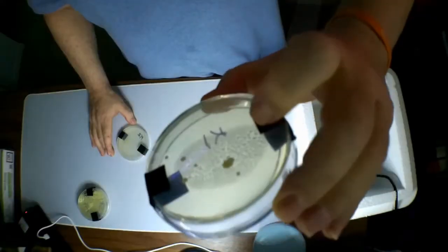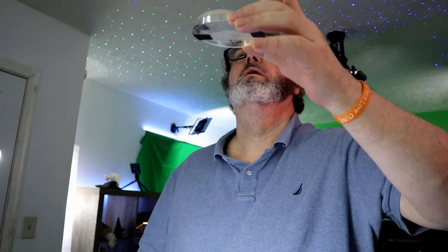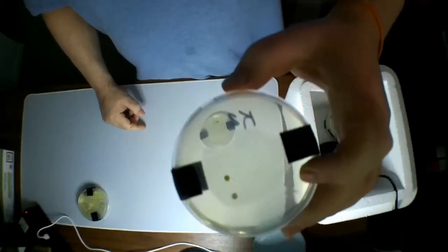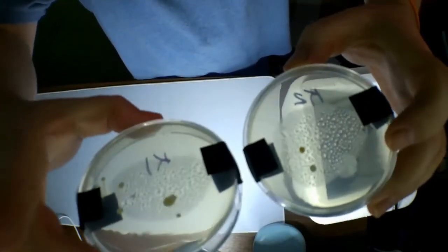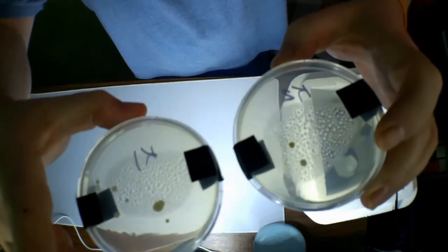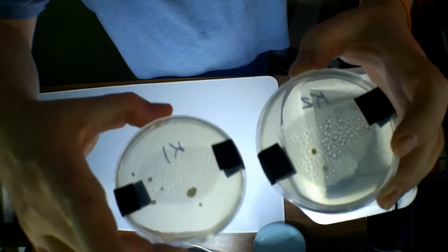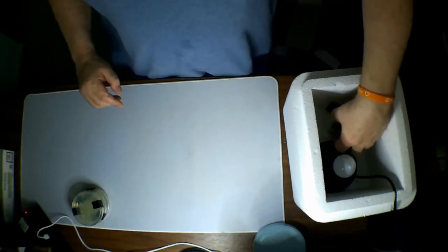So what's next? The keys, I think, were next. Okay, here's the key 1. And it's got a little bit of bacteria, nothing substantial. And here's key 2. If we are going to compare, I would say there is probably 1/3 less bacteria in key 2 than there is in key 1.